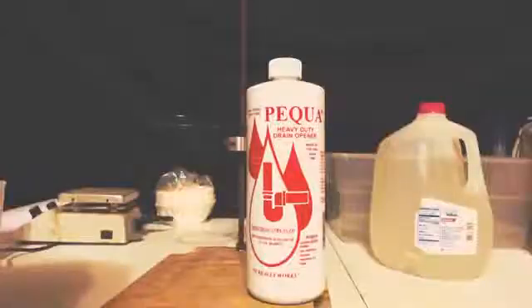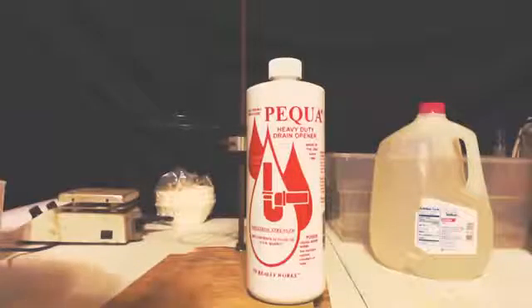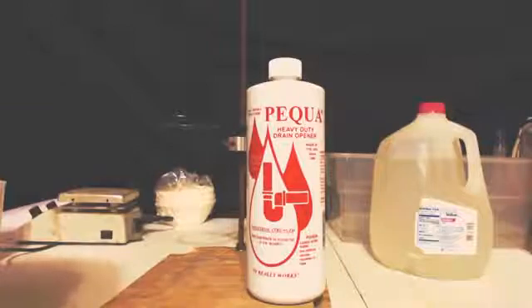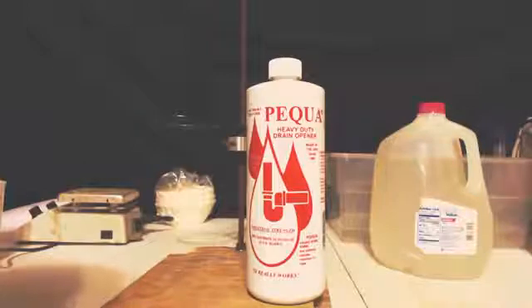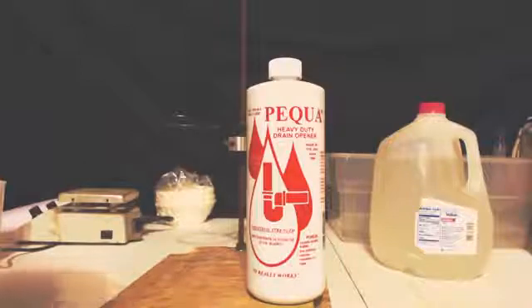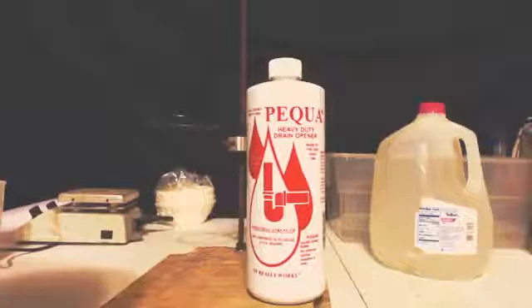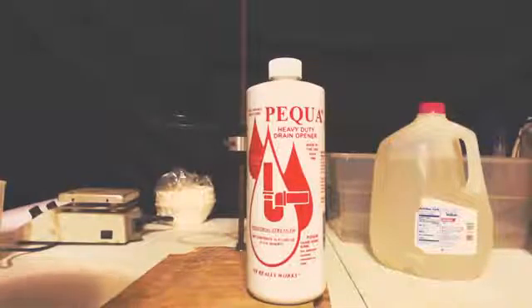I just threw them in the oven, turned it on for a little bit and let them dry out there. Let the pilot light do the rest, maybe even put them on a radiator. Here's a great tip for any home chemist: instead of buying a bottle to put it in, you can take your old bottle, wash it out, let it dry, and then store your stuff in there. That way you know it's not going to eat through it.